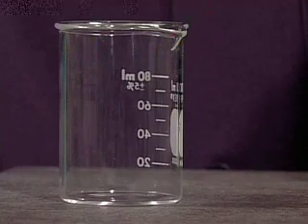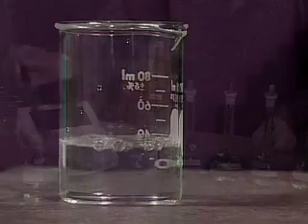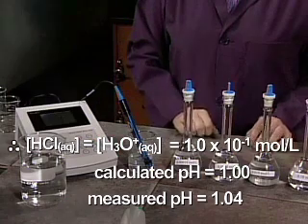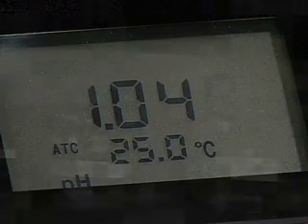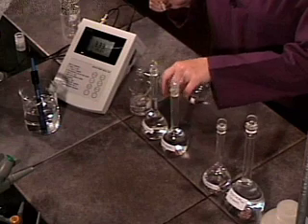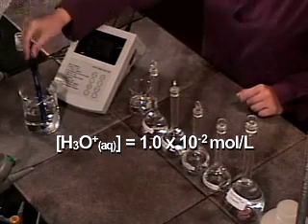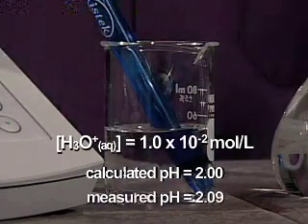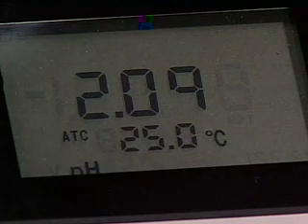The solution is poured into a beaker. The pH is measured and found to be 1.04. A second, a third, and a fourth dilution are performed, and in each case the pH is measured. The concentration of hydronium ions after the second dilution is 0.010 mole per liter. The pH meter reads 2.09.